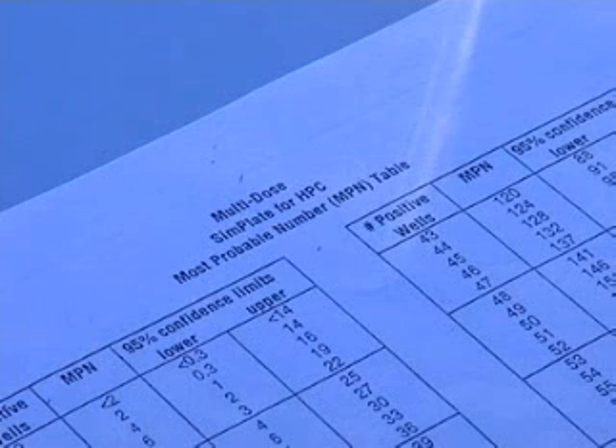The table takes into account the sample media poured off in step number 4 above. Be sure to dispose of samples according to local regulations.